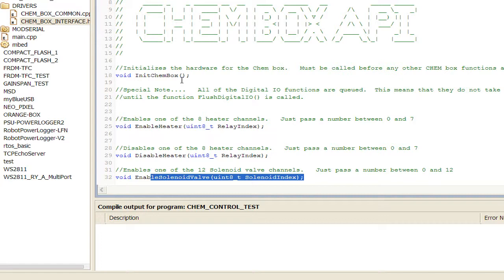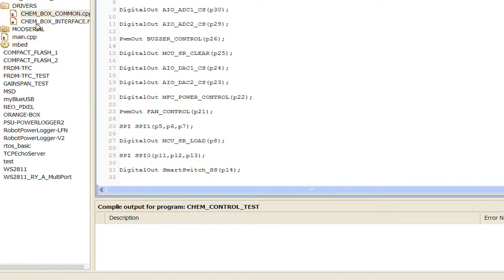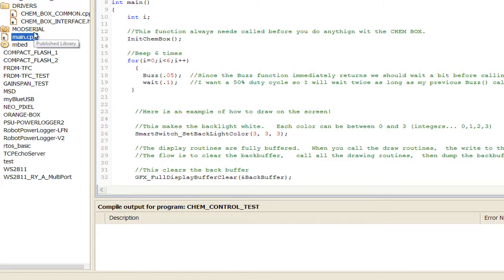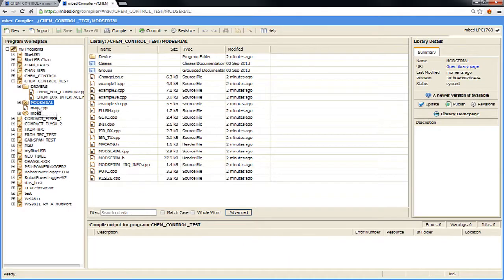Now we're going to come back and look at this in a minute in more detail. I want to show you basically how you compile the software out of the box and some other high-level features that I have in the program. So I'm going to go back to main. The only other thing besides the C file that's a dependency, a library, is another library in the mbed ecosystem called modserial, and it's a serial port driver that has a nice queue on it. I really like using it as a serial port driver. They have their own stock one, but this one has some other functions. So if you were to create a project from scratch, you basically need these two files and modserial. But the easy way to start a new project is just to import the stock example and edit that before you get going.